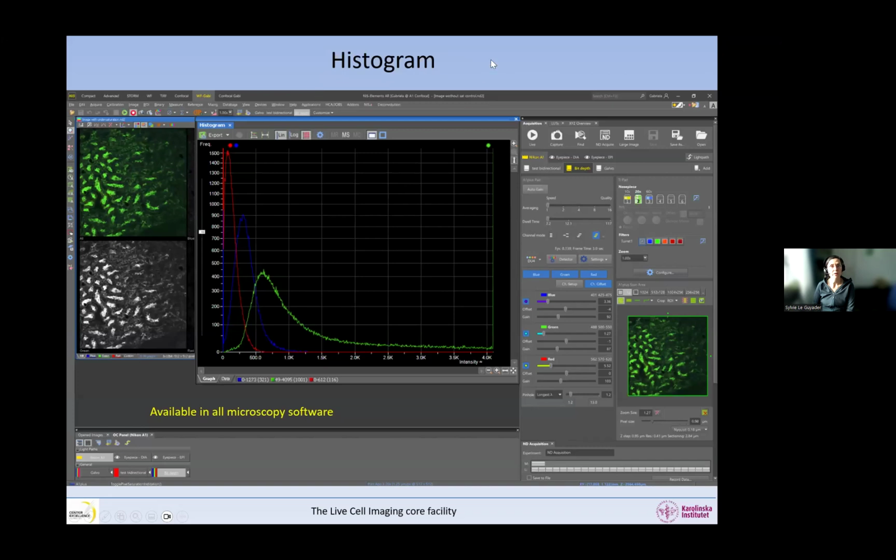So now another thing that we can look at to explore the intensities in our sample is the histogram. Again, it's available in all microscopy software, but this is in the Nikon software that we are showing it. The histogram shows you the number of pixels for each intensity. You can say, okay, at this intensity, for example, there are about 1,000 pixels that have the intensity of 150 or 160, something like this. So it's a histogram.